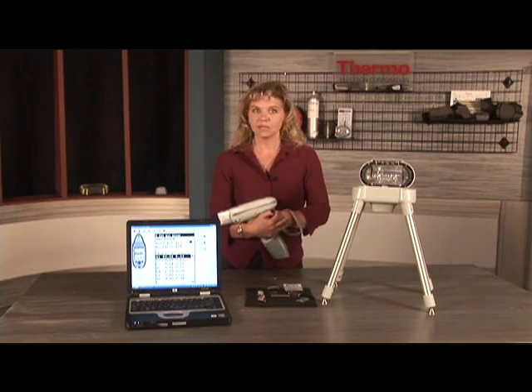Aluminum alloys of any size or shape are a special case and should be undertaken only after your sales representative has provided specific training. As we said previously, the instrument operator will still need to be alert and able to make good judgments in cases where the sample is not clearly representative at the measurement surface, or it cannot be fully analyzed for all alloying elements. Some surface coatings are not obvious because they are similar in color to the alloy, for example. Examples are silver or cadmium metal coatings that might look like the alloy itself. Some examples of the need for a judgment call on the part of the operator will be given next.